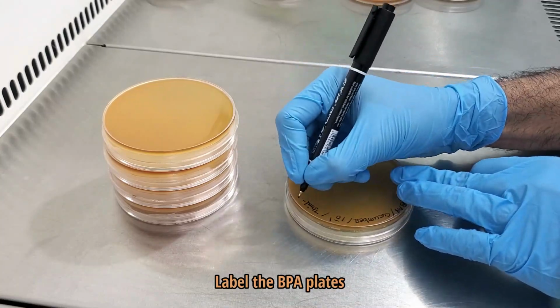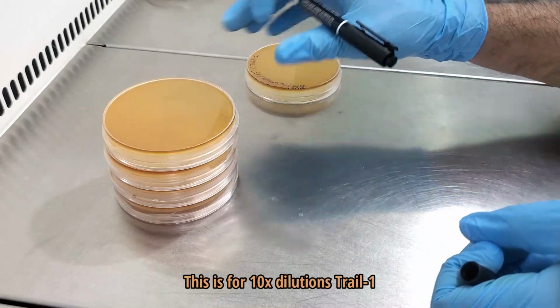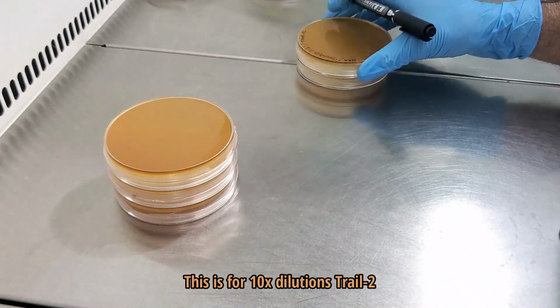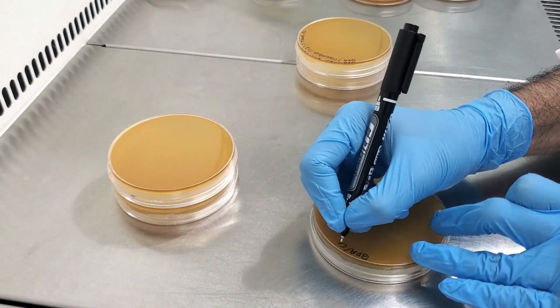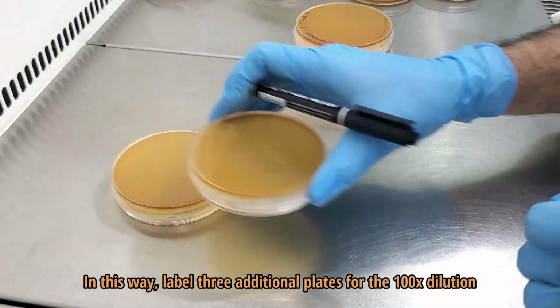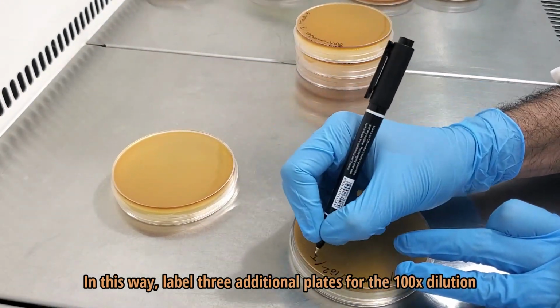Label the BPA plates. This is for 10 times dilution trial 1. This is 10 times dilution trial 2. And this is 10 times dilution trial 3. In this way, label 3 additional plates for the 100 times dilution.